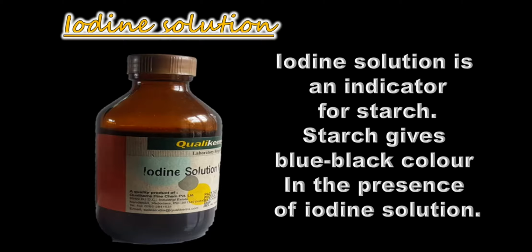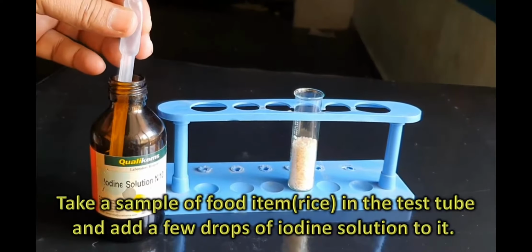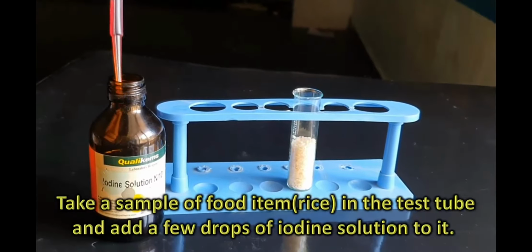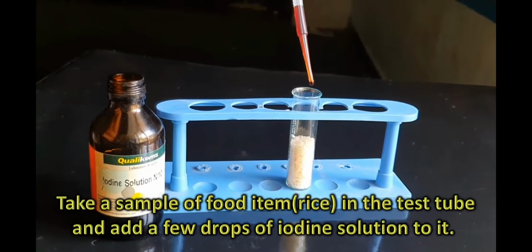For that we need an iodine solution, because iodine solution is an indicator for starch. Starch gives blue black color in the presence of iodine solution. So this is a picture of iodine solution. We will take a sample of food item, which in this case is rice, in the test tube and add a few drops of iodine to it.